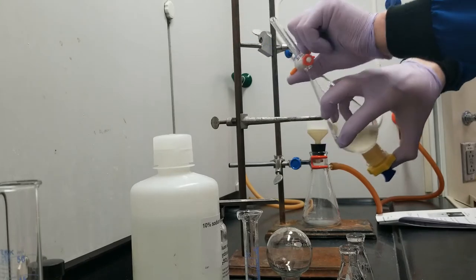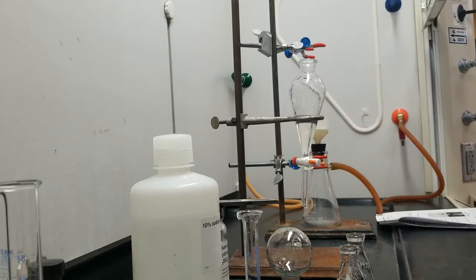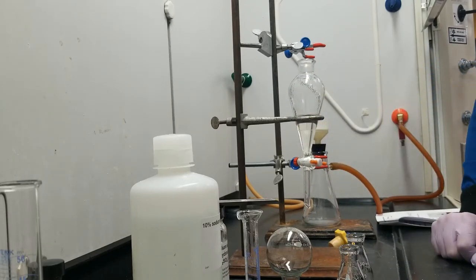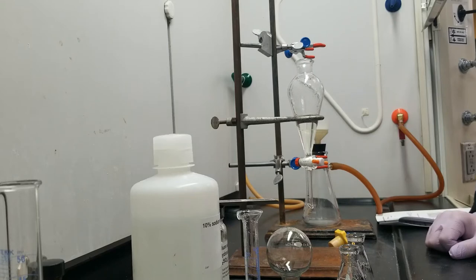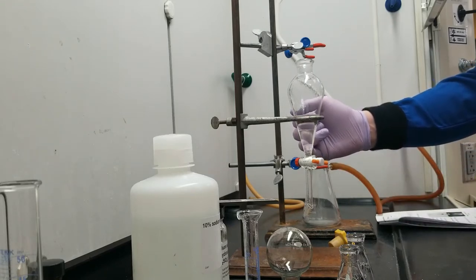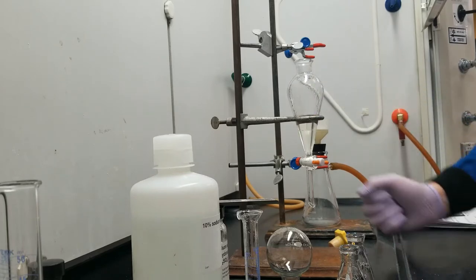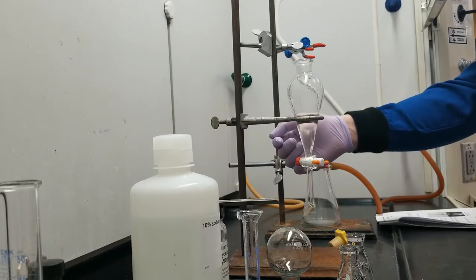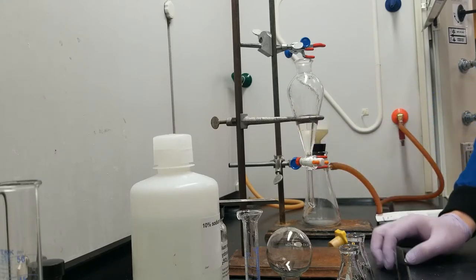I'm getting way less gas now. I feel pretty good. That's separated really nicely. But I have two clear layers right now. Please excuse me if you can't see them, they're actually a little hard for me to see. But I've got a clear aqueous layer on the bottom and a clear diethyl ether layer on top. And my 3-chlorobenzoic acid, now that it's been deprotonated to its benzoate form, that's dissolved in my bottom layer here. So I'm going to go ahead and collect that.